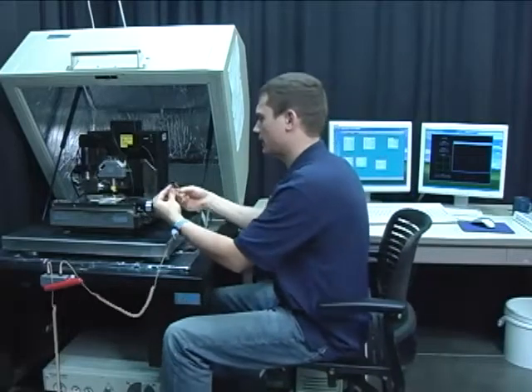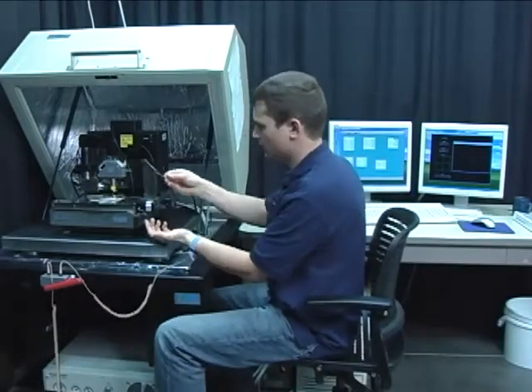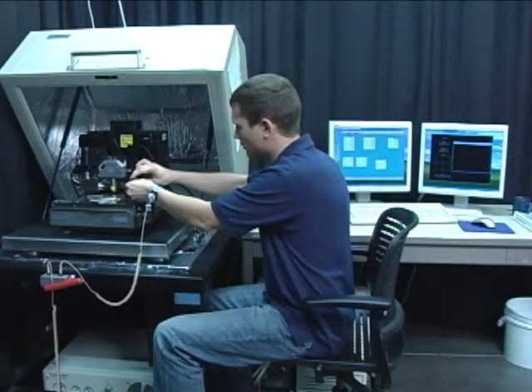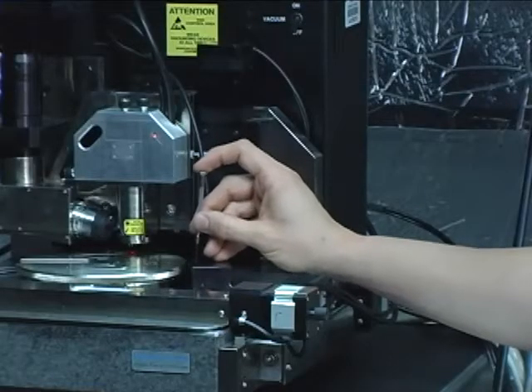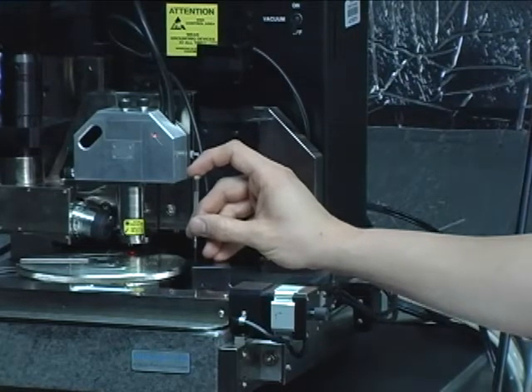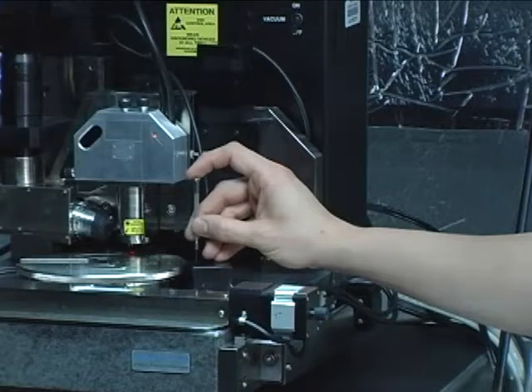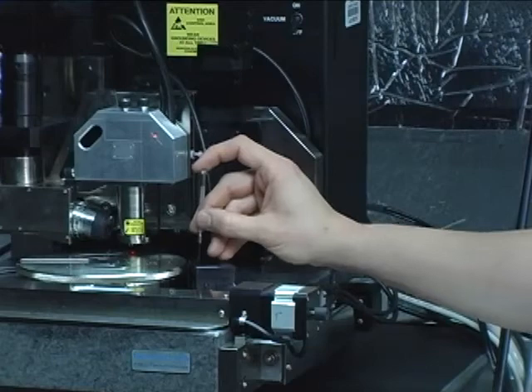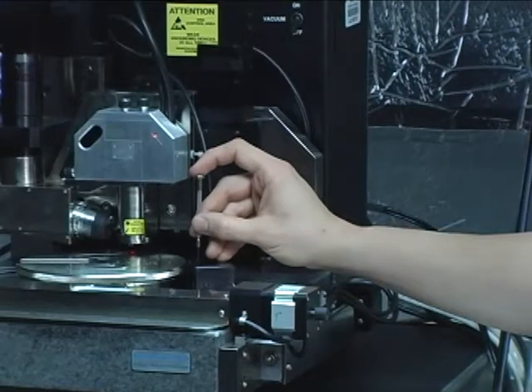Perform the calibration by plugging in a precision wire wound resistor. Adjust the amplifier offset in the module using the screwdriver. Make a small change and observe the change on the screen until my amplifier is zeroed out.